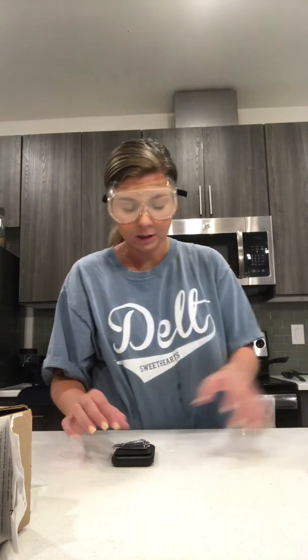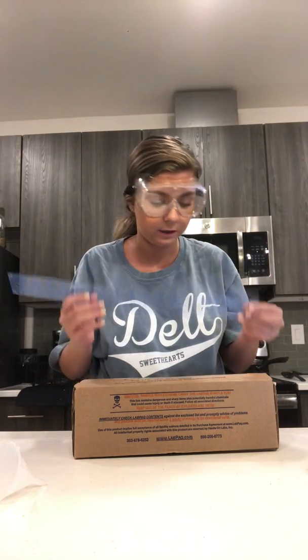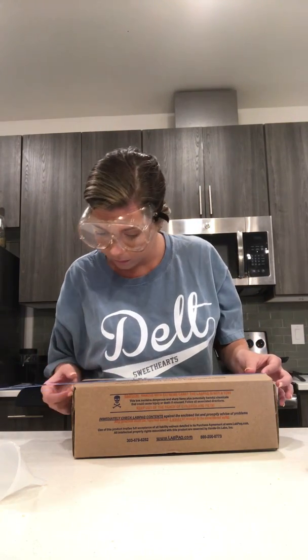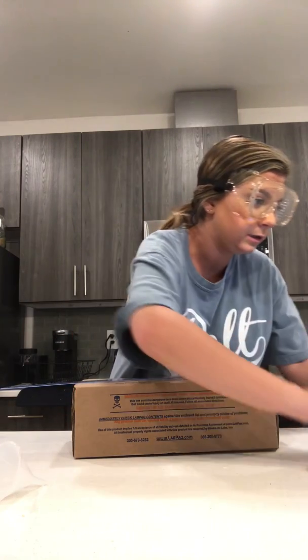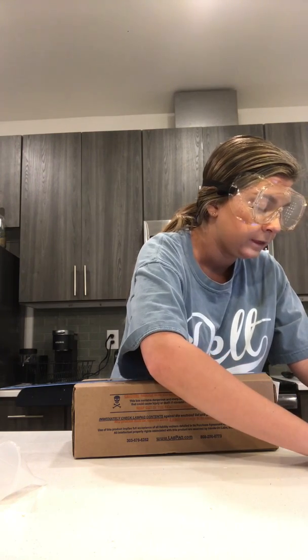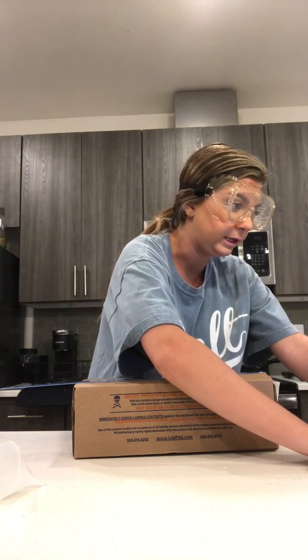So now I'm going to measure the length of my wooden block, and so I'm going to be using this, and then I'm going to measure the length in centimeters. So I have my ruler, and it's coming out to 32 centimeters exactly, so 32.0. So my estimated digit would be 0, and then my number of significant figures would be 3.